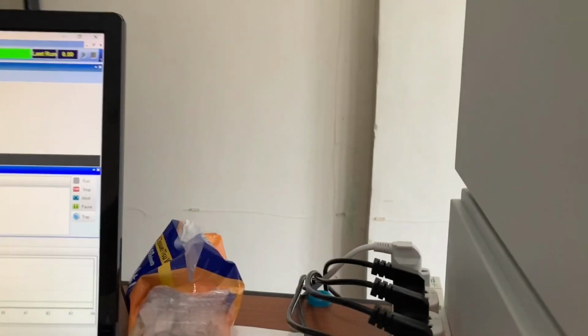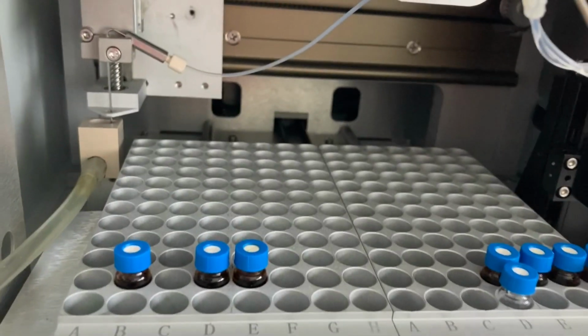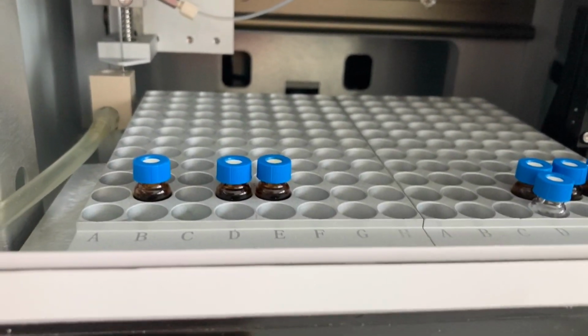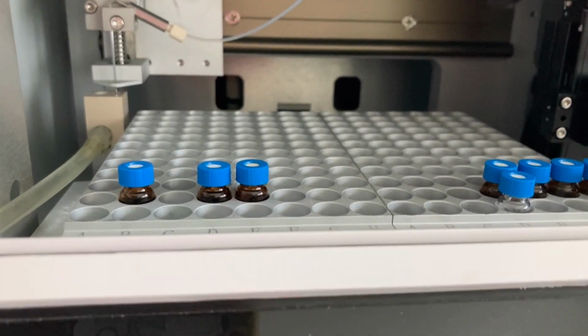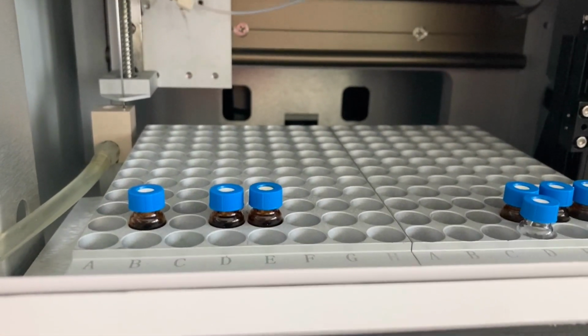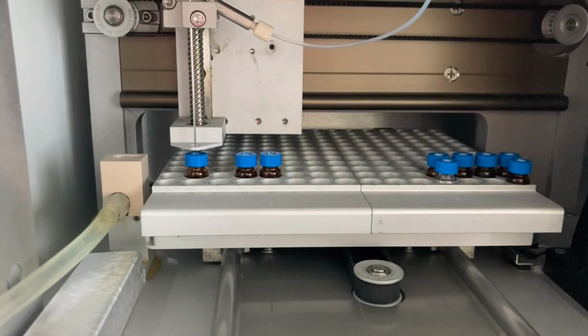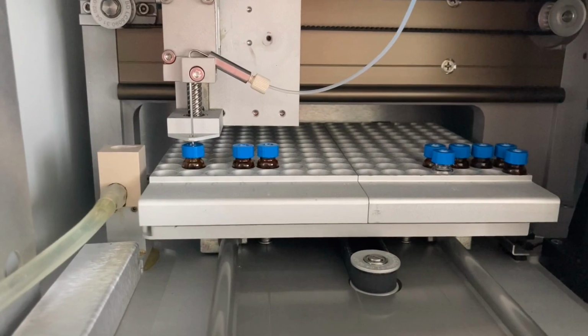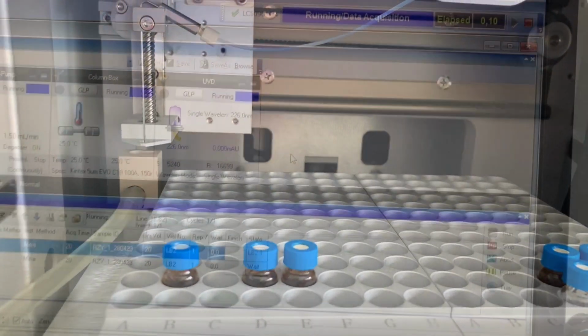Right, so come over here. And LB2, I always have another little double check. The needle goes down into the vial, yep.